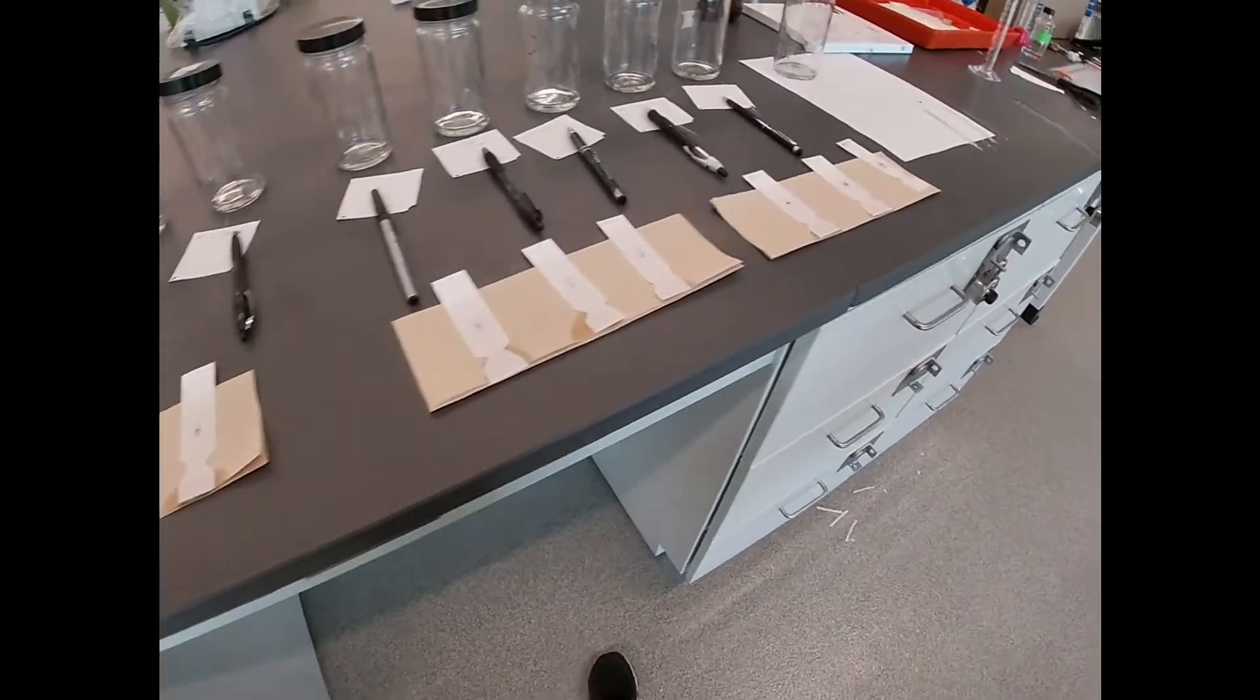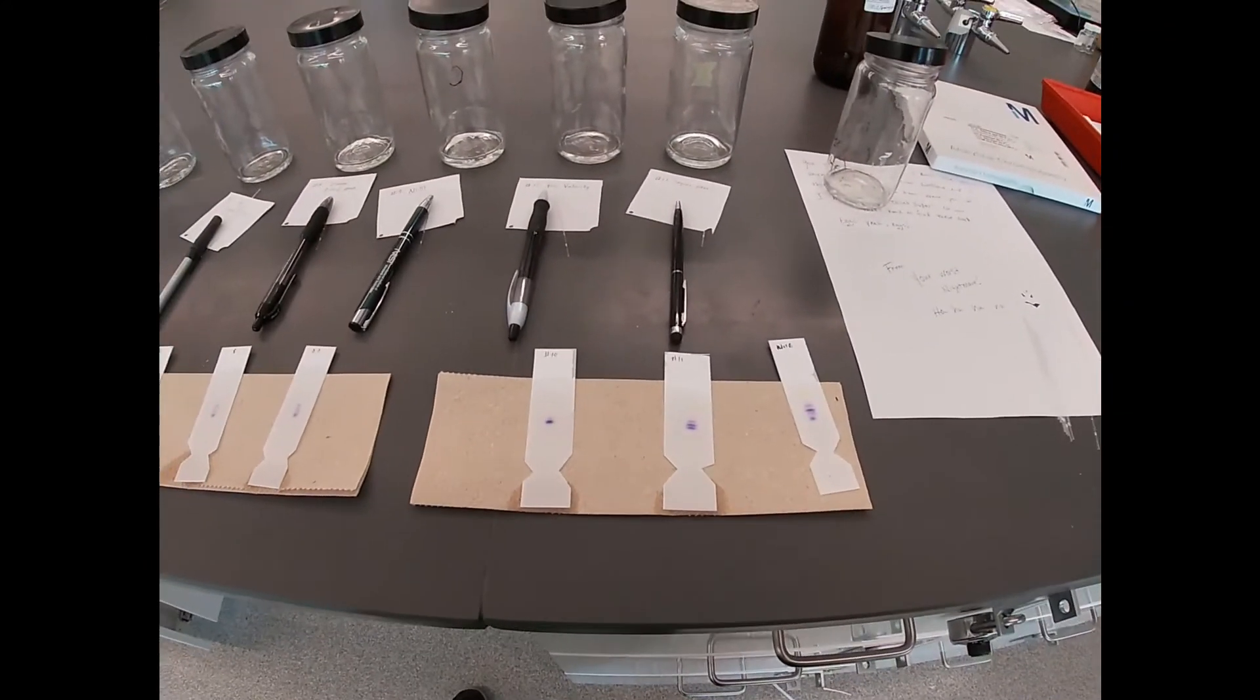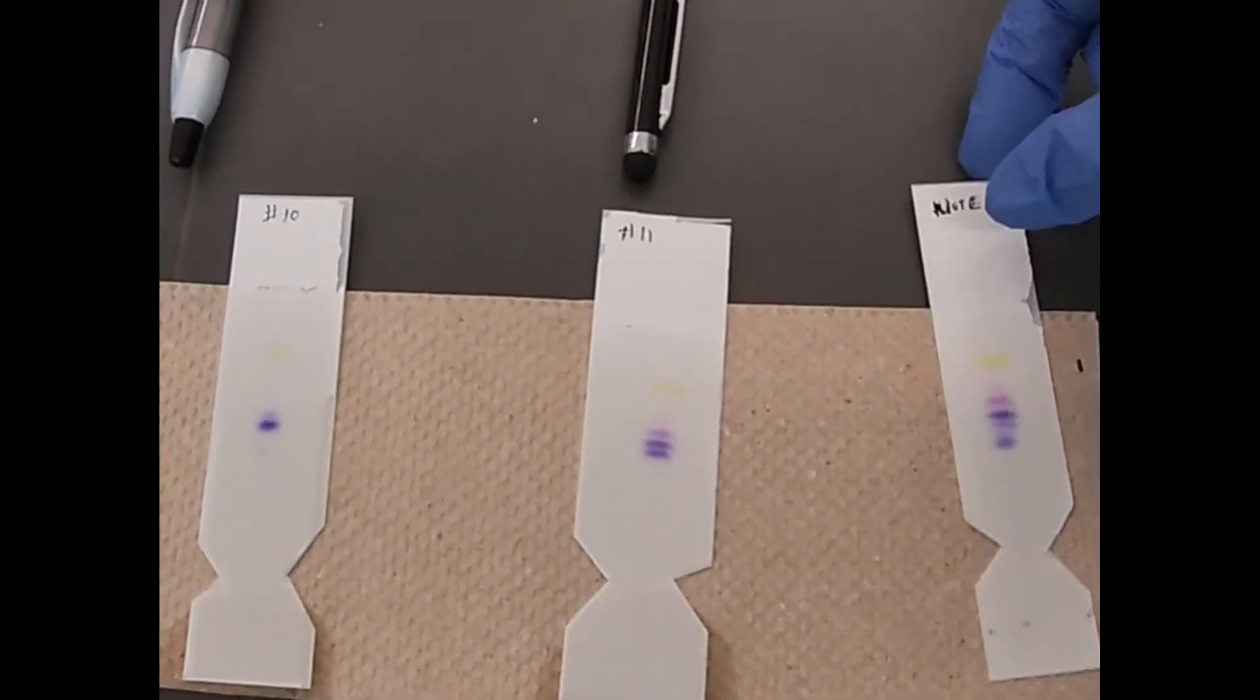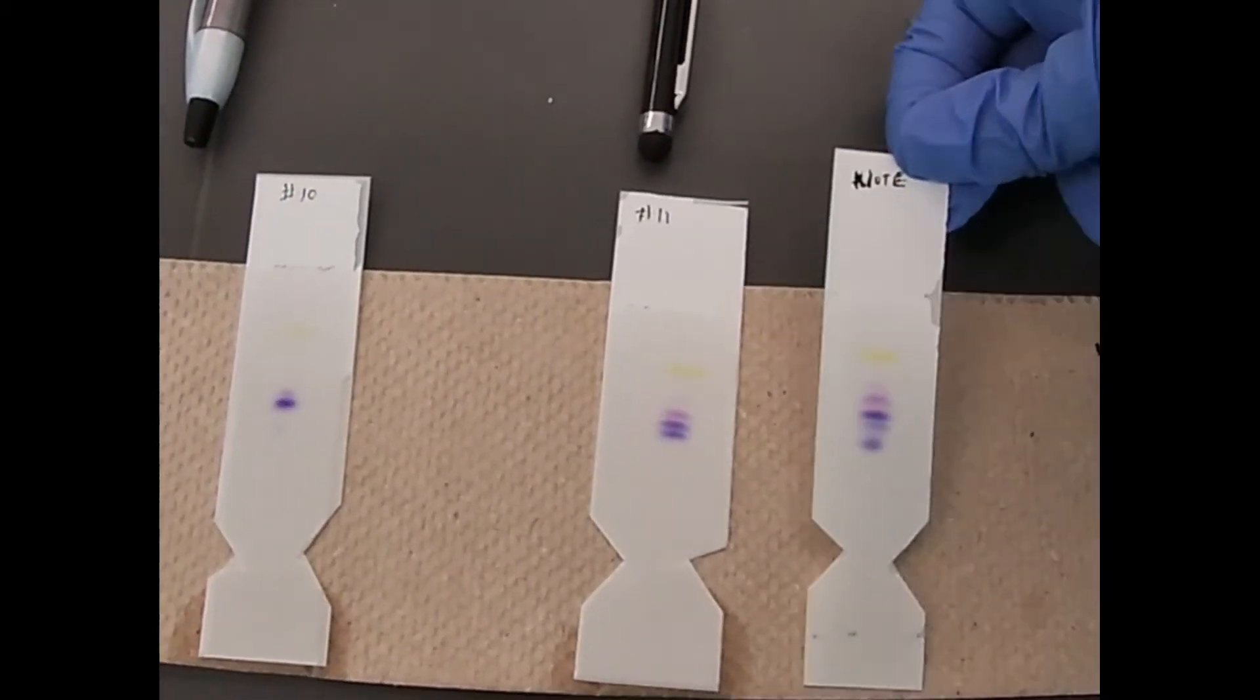All right, so we're going to let these dry, and once they're dry we're going to make our measurements. You can already see some similarities, and here's our note so we can do a comparison.